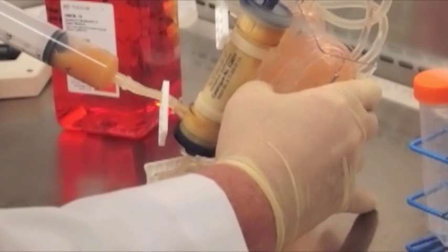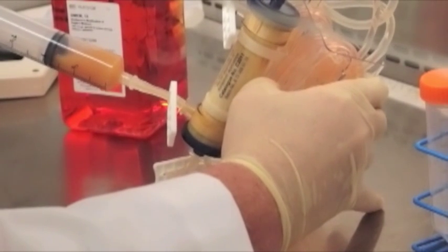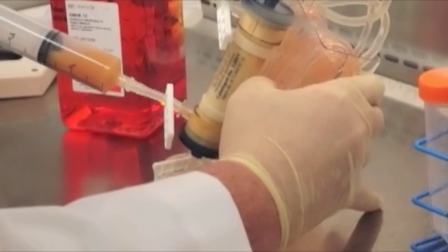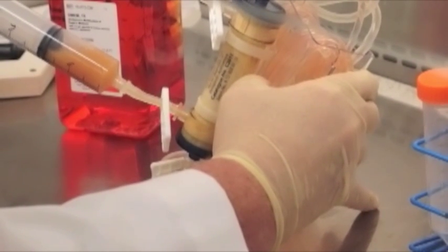We can see by their color in the syringe that their density is in excess of 1 times 10 to the 8th cells per mil, meaning a very high density. This is what allows us to utilize CDMHD.